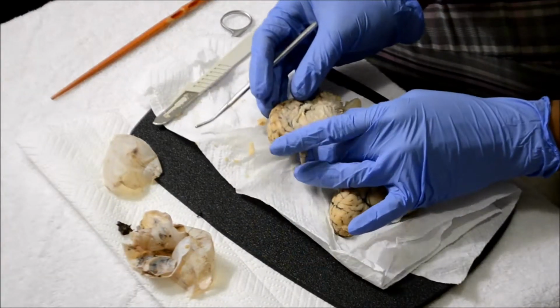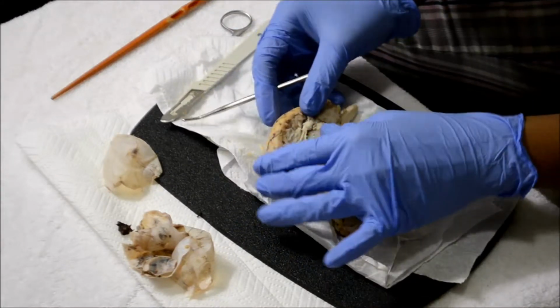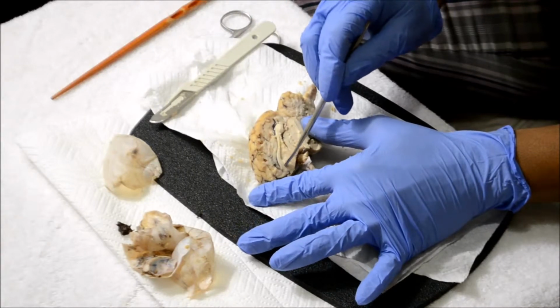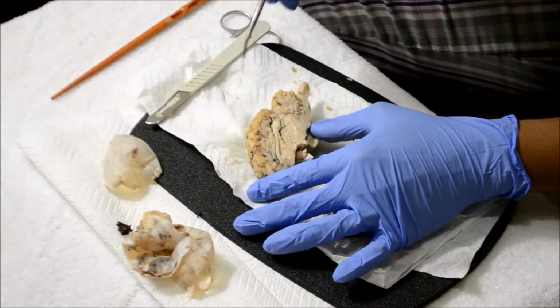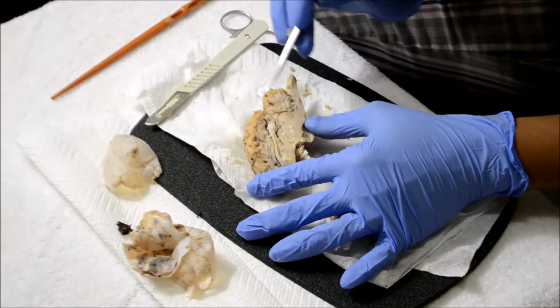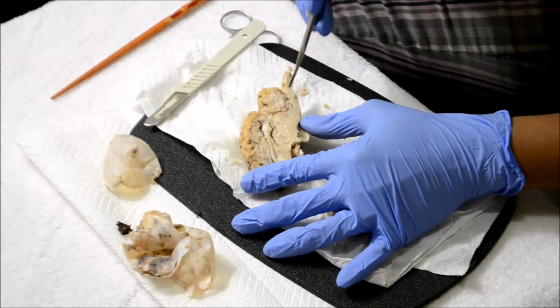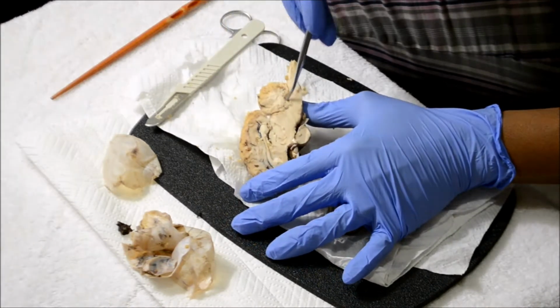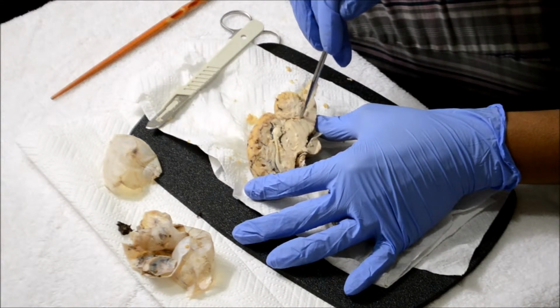Next is the mid-sagittal view of the half brain of the sheep. Here it is. First would be the corpus callosum, which is this right here. Then the thalamus, which is right here. Then the third ventricle, which is this right here. The fourth ventricle is over here, the fourth ventricle right there. Then the cerebral aqueduct, which is this right here, all of this.